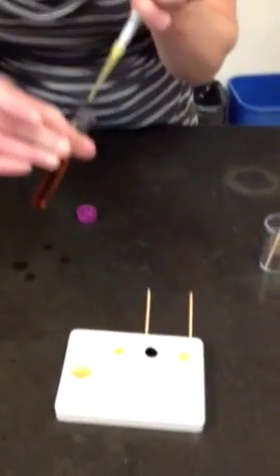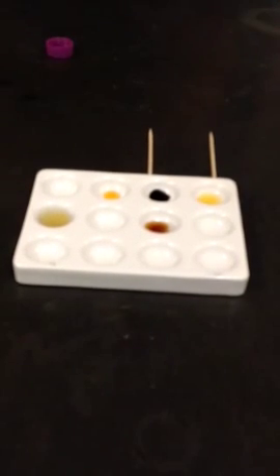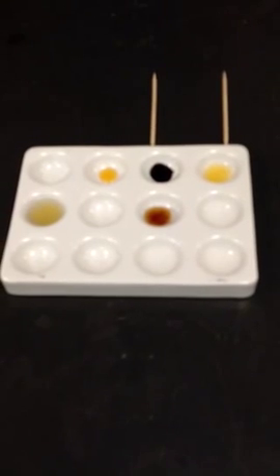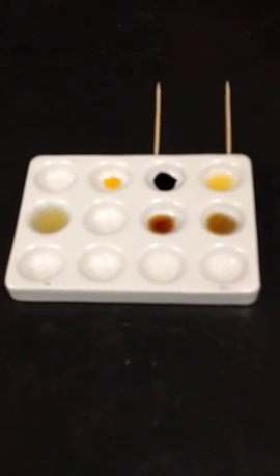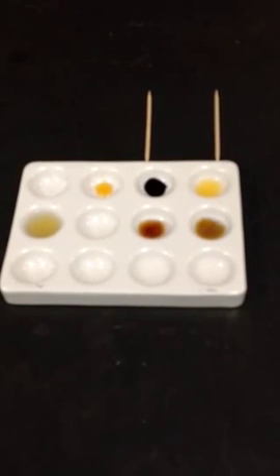All right, well now I'm ready to see if the starch is all digested. So I will try in 1 well. Oh, well, it's certainly not black like it used to be. It appears that there's still a little bit of starch left. It's not yellow. We can leave that one a little longer. And this one here, which is a similar color. So we can wait a few more seconds and test the other well.